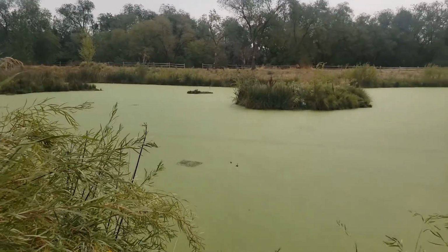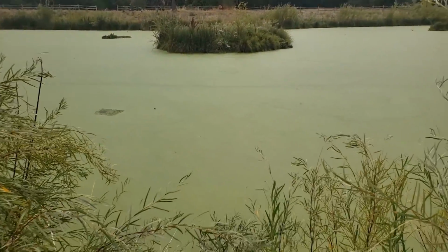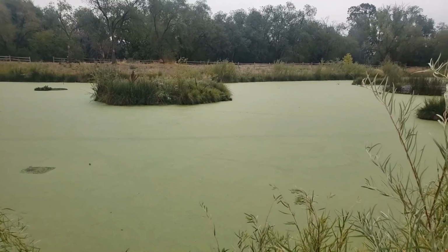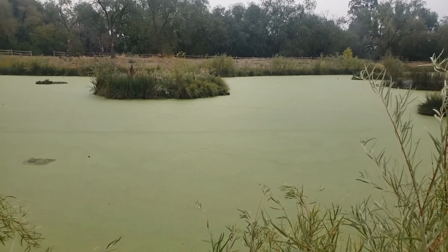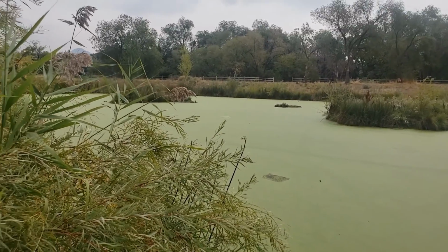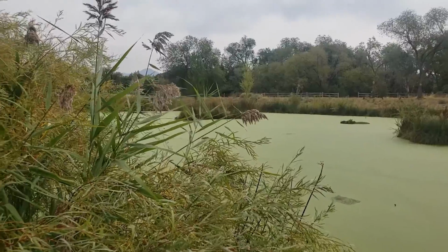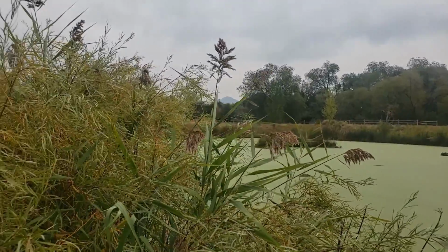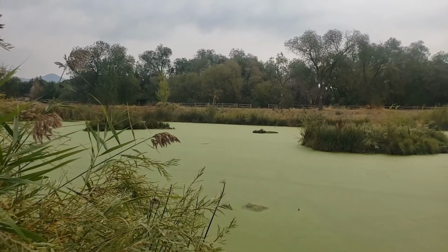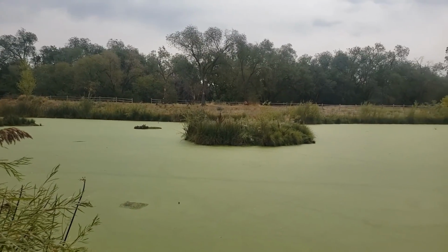You're going to want to know if there's too much nitrogen, and so then there's algae blooms, which end up causing dead zones, because the algae, when it decomposes, takes up a lot of oxygen, meaning that other things can't live. So we're going to learn about this and so much more, but let's dive into the actual tools that we use to measure, and we'll do a water quality sampling together.